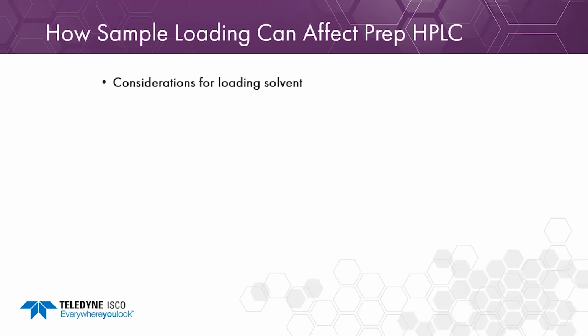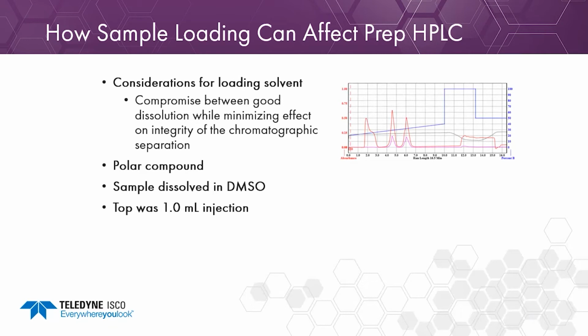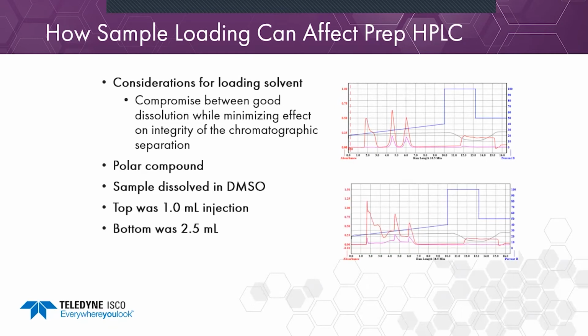So how can sample loading affect prep HPLC? Considerations for your loading solvent. Like for flash, it's a compromise between good dissolution while minimizing the effect on integrity of the chromatographic separation, right? So this is a polar compound dissolved in DMSO. The top is a 1 milliliter injection. You can see the DMSO peak here is that first peak, and then we get baseline resolution between the next two compounds, which are both fairly early eluting compounds. As I increase the amount of DMSO, though, if I increase that injection volume to 2.5 mils, you're going to see that the first peak of interest starts to co-elute with the DMSO peak, and we're not going to get good resolution between peaks 2 and 3.